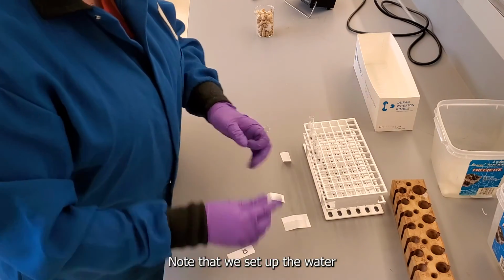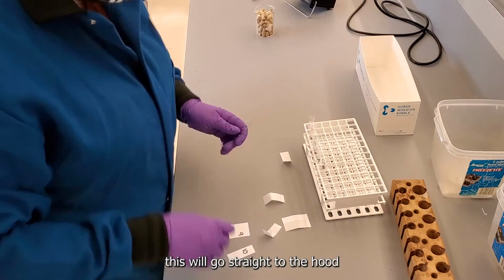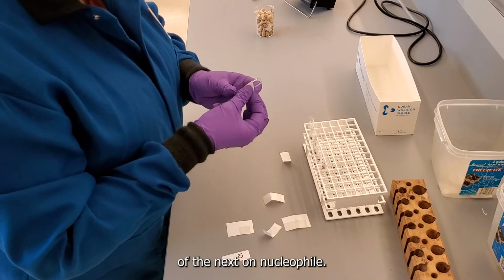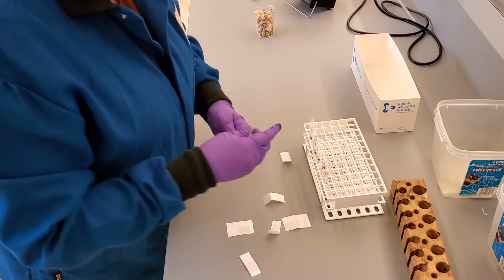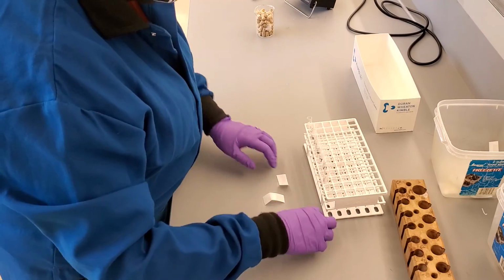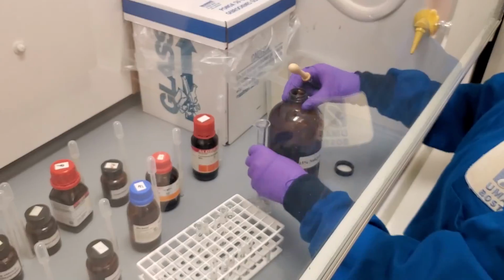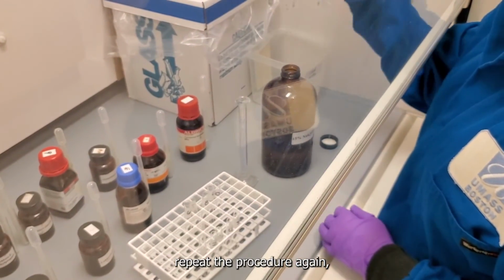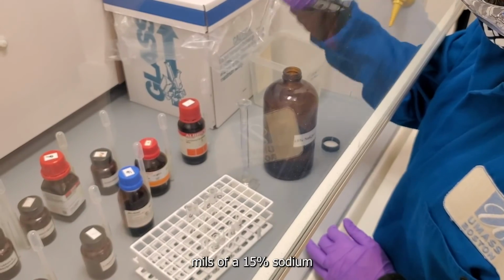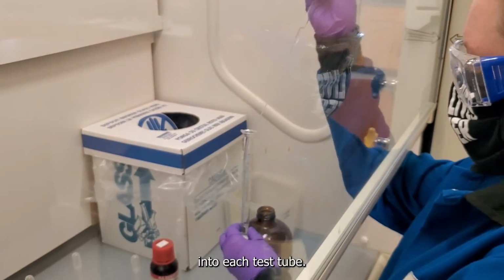Note that we set up the water bath in the last experiment and it's still going, so this will go straight to the hood and show the addition of the next nucleophile. Now that we're in the hood, Tara will repeat the procedure again, but now she will add 2 mL of a 15% sodium iodide in acetone solution into each test tube.